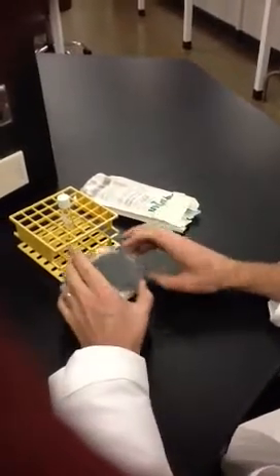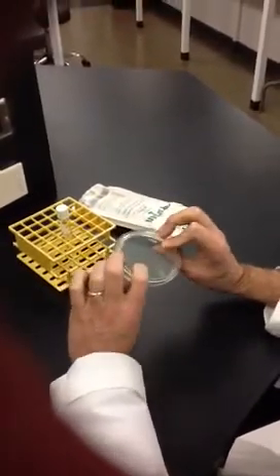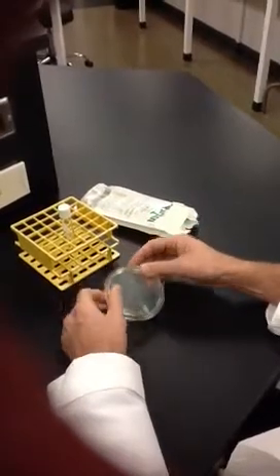This is how to prepare a microbiological lawn for doing antibiotic resistance testing.